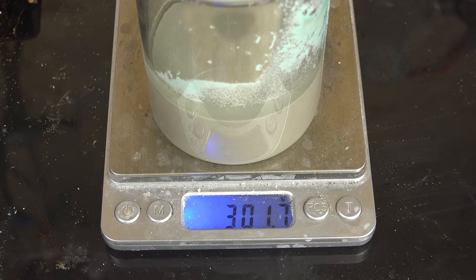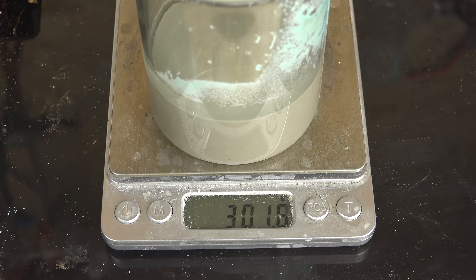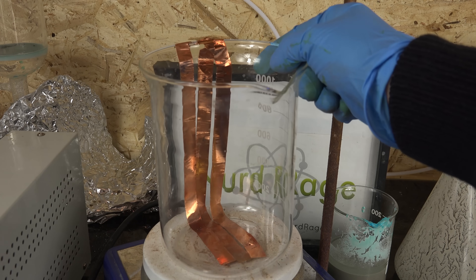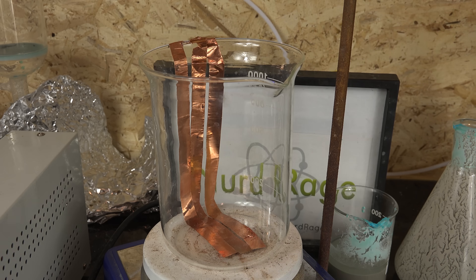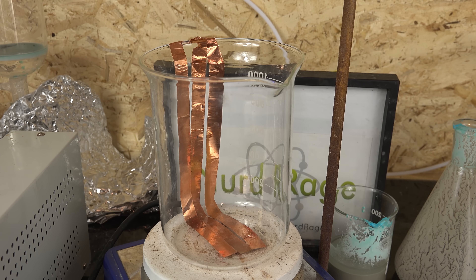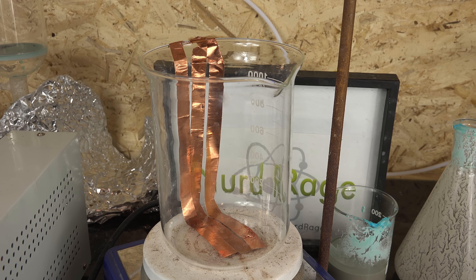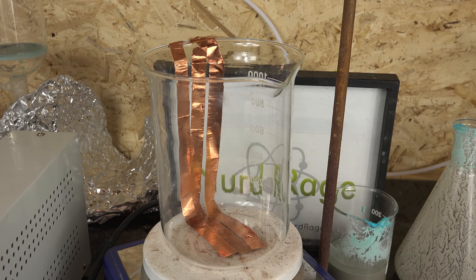First weigh the slurry so we know how much water to use later. We need to have at least twice as much mass in water as we have in sulfuric acid and copper sulfate. I have about 300 grams so I'll need 600 grams or 600 milliliters of water. Now we need to set up our electrolysis cell. Get a large beaker that can contain both the water and slurry, and get a large copper electrode. I'm using copper foil but you can also use copper sheets or copper wire. Just as long as it has a large surface area it will be fine. You'll also notice I made sure the copper electrode was on the bottom of the beaker. This is optional but it lets us do electrodeposition without stirring.